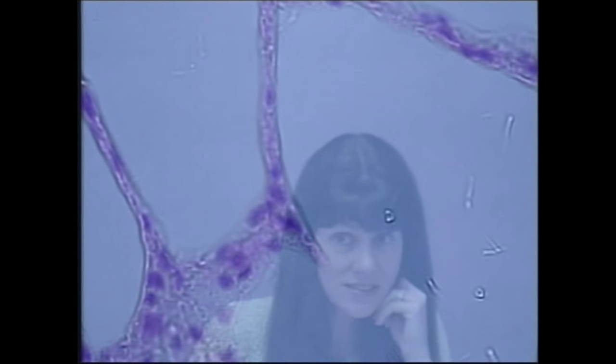As you look at the screen, you're going to see a simple squamous epithelial cell right over here. You can see how flat the cell is. You can see that the nucleus of the cell is somewhat oval, because again, the cell is flat in shape.